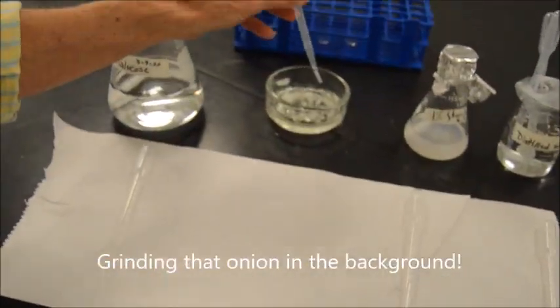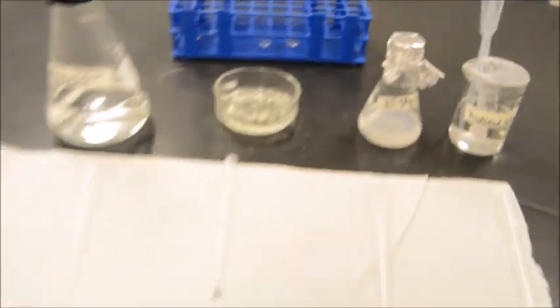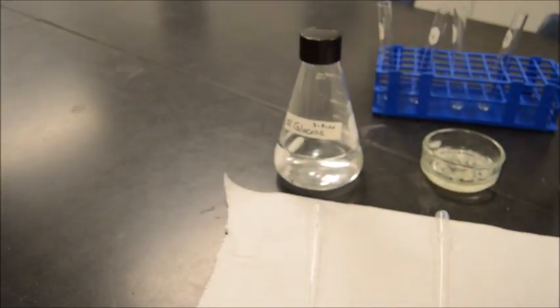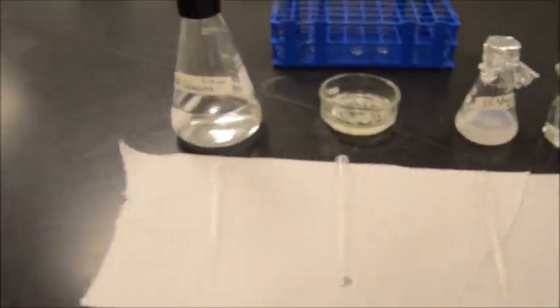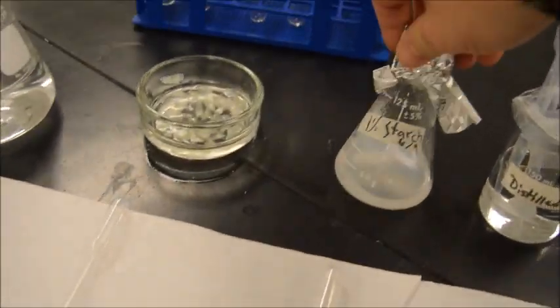What we have here in front of us are 4 solutions and 4 test tubes, all of which will be tested for simple sugars. If you check your lab manual, we've got 4 test tubes, and those test tubes are supposed to be lined up as glucose, which is there, onion juice, which is in the second place, starch, which is the third one, as you can see here, and then, of course, distilled water.